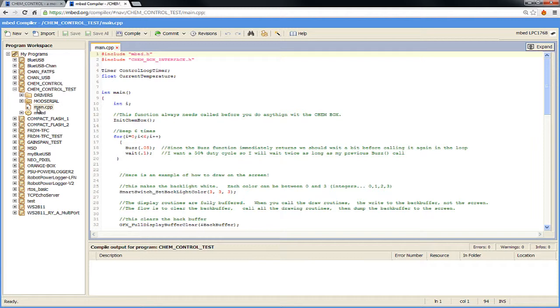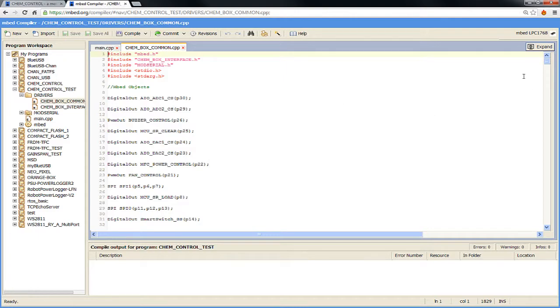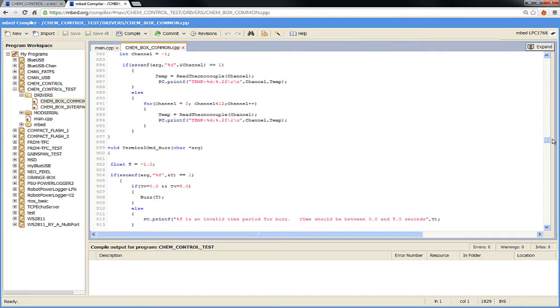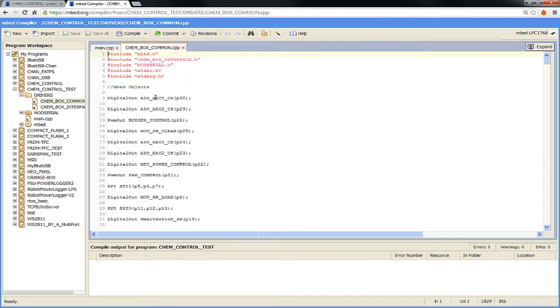Now, mbed is all C and C++. The good news is the mbed libraries and libraries I've given you are pretty foolproof. You don't have to know a lot about low-level C to program it. And once you look at a program, you'll get an idea how it works. So, some things I want to point out. All of the low-level drivers that I wrote are in this drivers folder. So if you're ever curious about seeing the source code, it's all here. It's in this ChemBox common. And you can scroll down, and this has all the low-level code that makes all the hardware work. Now, the good news is you don't ever have to worry about how all this stuff works.